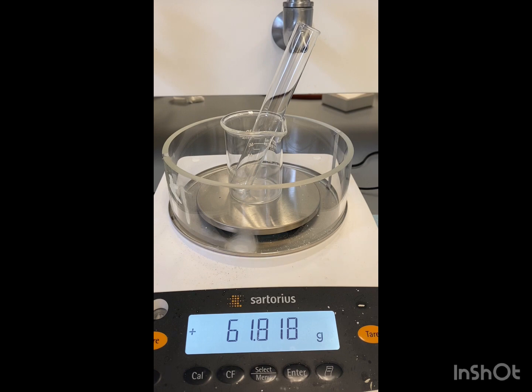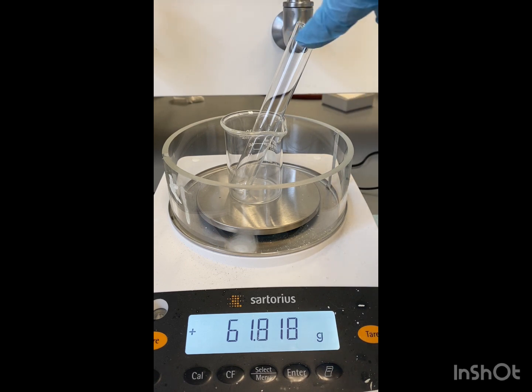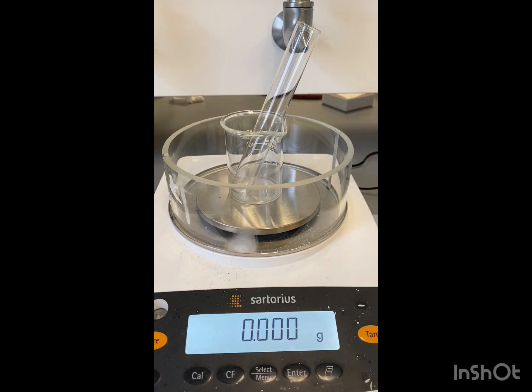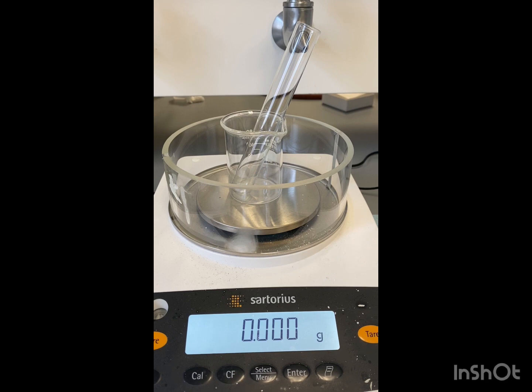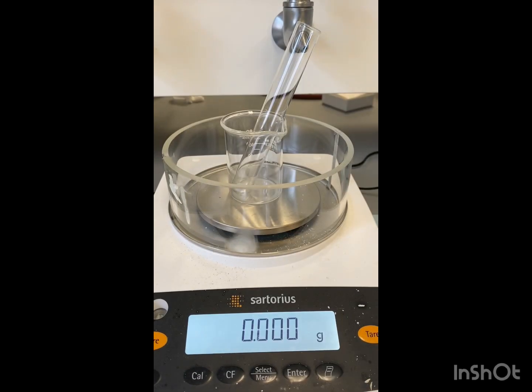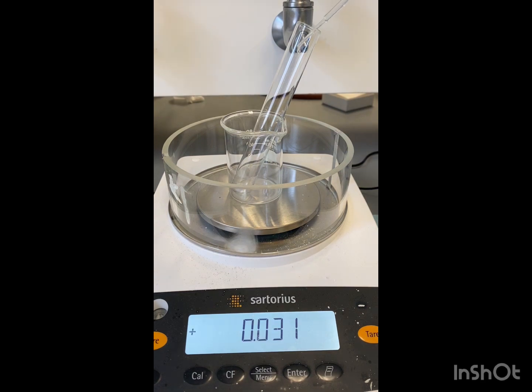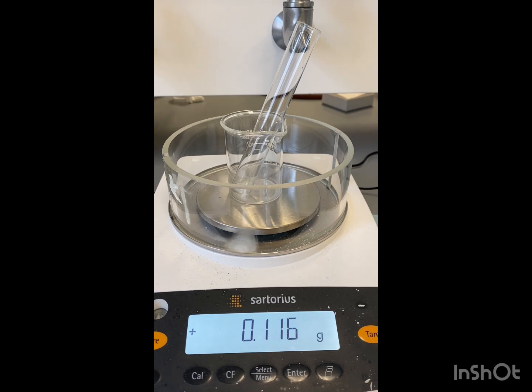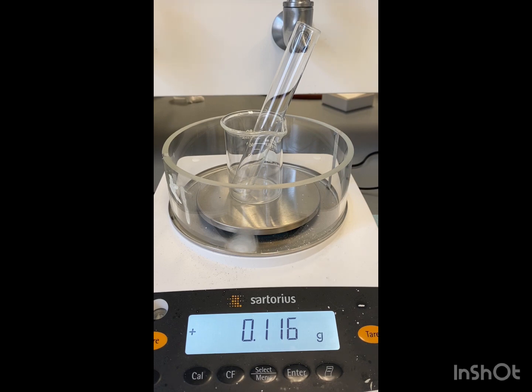I'm going to go ahead and try to weigh that out. I have a beaker to hold my test tube — you can use a smaller test tube than this. I'm going to go ahead and tare it and then get our methyl pyruvate. Here it is, methyl pyruvate. It's a little over what we want, but we'll go ahead and record that. I've also added our stir bar.